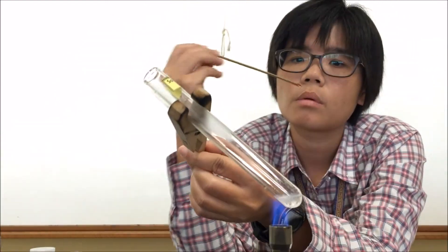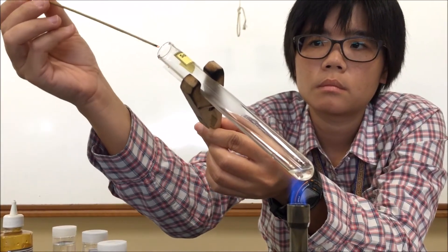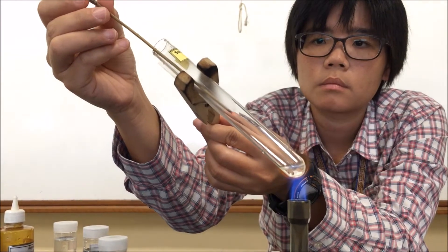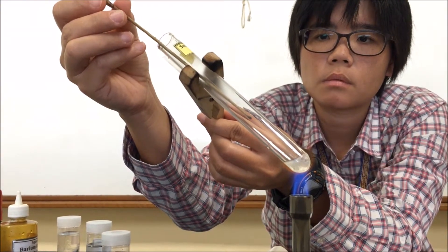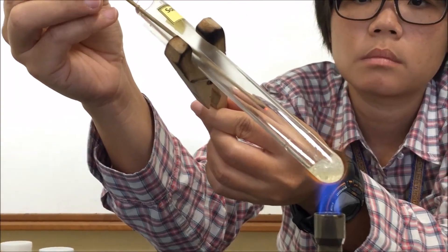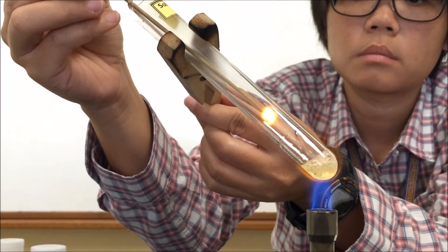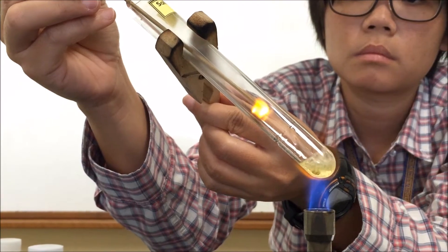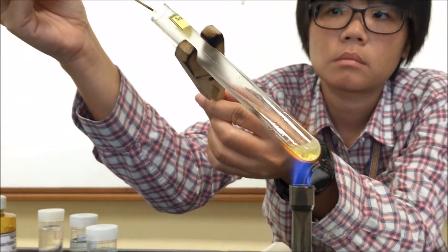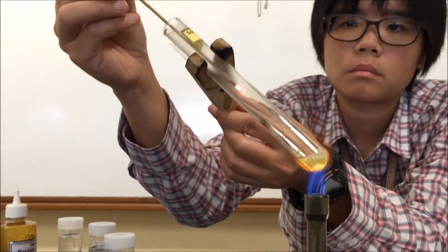We observe the colorless liquid. We see bubbles, bubbling. The colorless liquid is now changing color — it is becoming yellow. The glowing splint relights. We also note that there are water droplets at the sides of the test tube. All these observations should be noted down. That is a positive test for the glowing splint, which leads us to conclude that oxygen gas must have been given off.